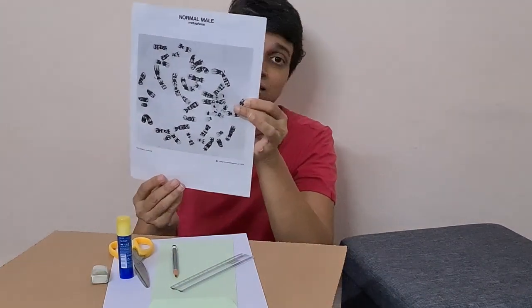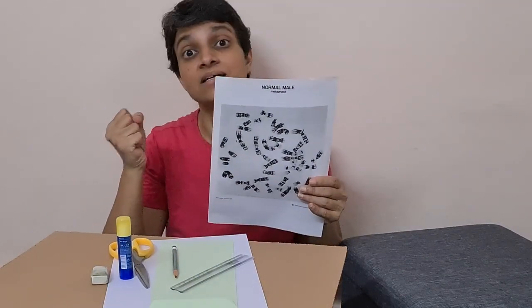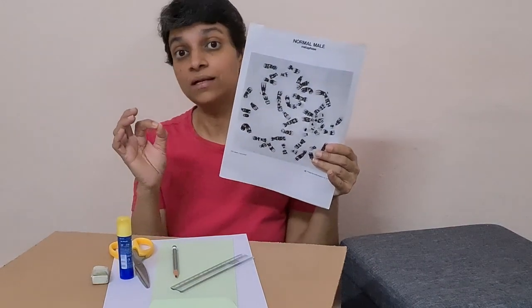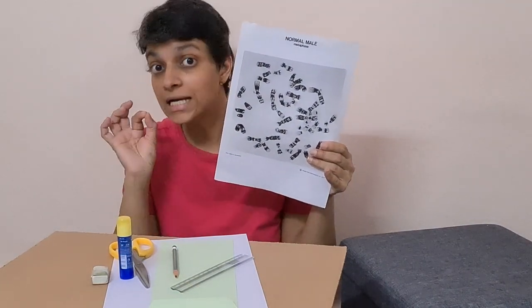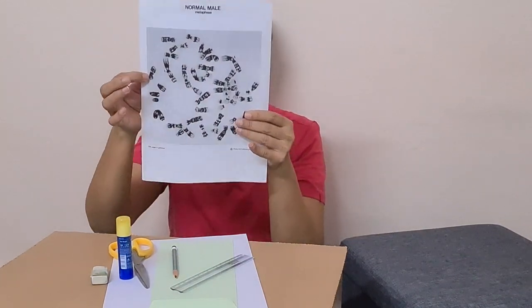Metaphase spread is preferred because metaphase chromosomes are highly condensed and they are clearly visible under the microscope as rod-like structures, with the constriction seen clearly.